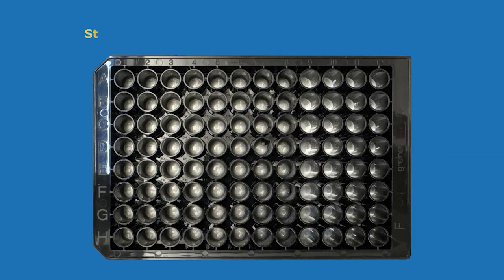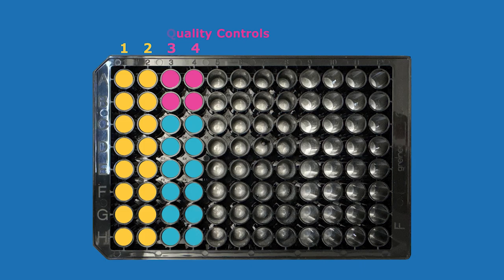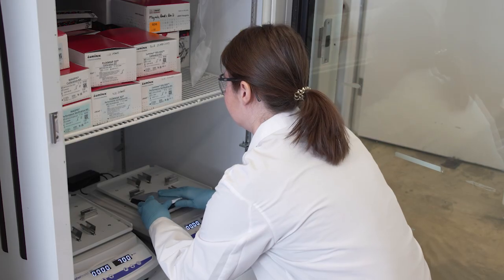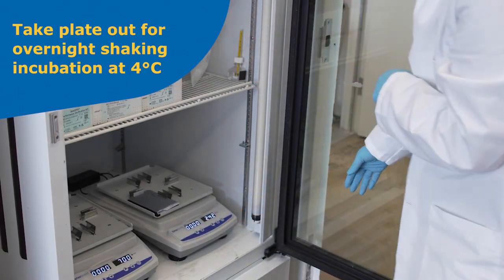The assay plate is now complete with the 8-point standard curve replicates in columns 1 and 2, QCs next in columns 3 and 4, and then samples. Plate setup is complete. Take the plate out for overnight shaking incubation at 4°C.